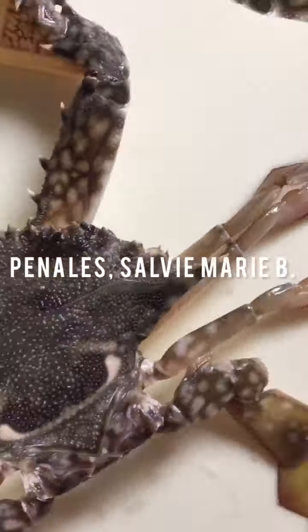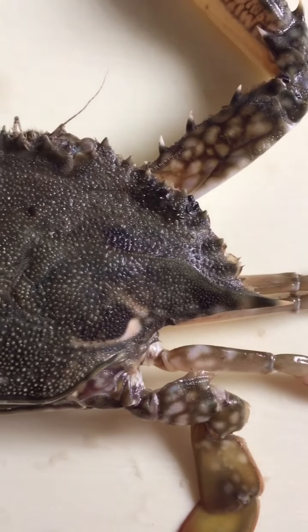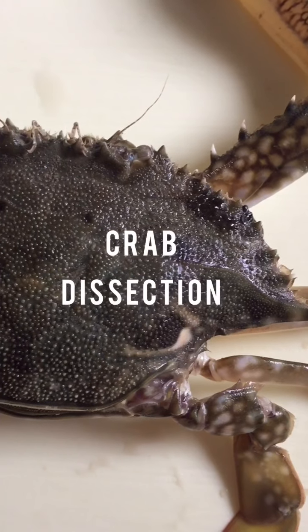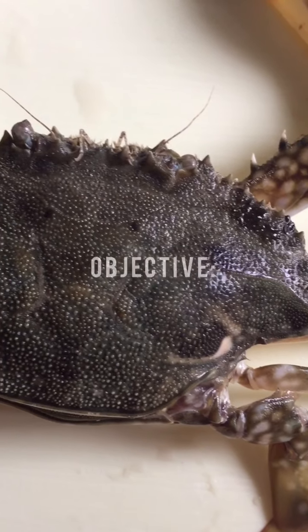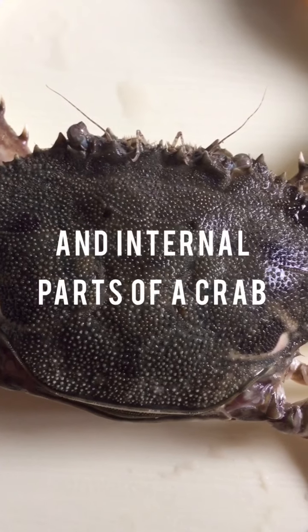Hola! Back again for another dissecting video. But this time, it is a dissection of a crab. We will be naming the external and internal parts of a crab.